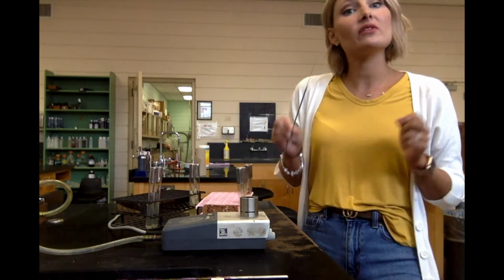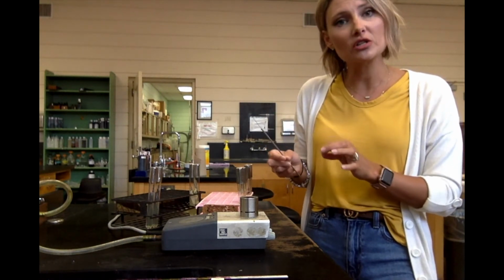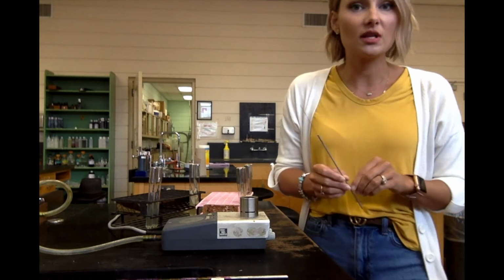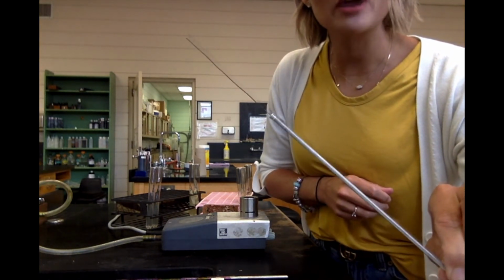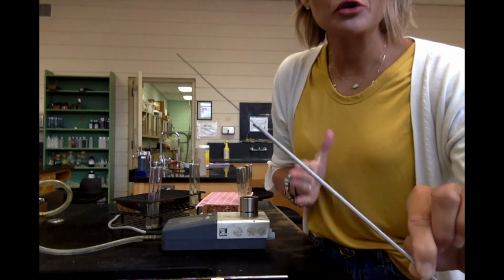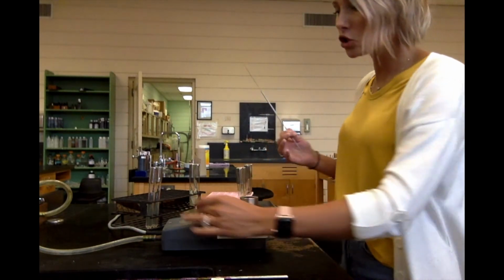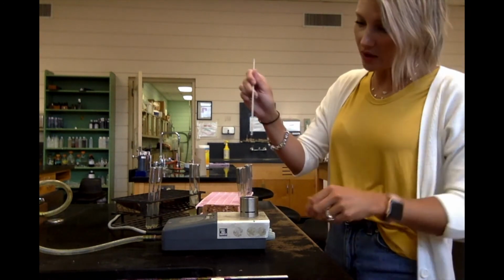So if you remember, we have an inoculating loop. We use that to do all of our stains and make our smears, and we're going to use the inoculating needle to do the stab, because we're stabbing it, so it would make sense we need to use a needle. So this is what our needle looks like. Okay, you want it to be as straight as possible, because when we're reading these results, we want our stab line to be really, really straight. So I've already straightened it, and of course we want to use aseptic technique, so we're going to use our fire boy. We're going to flame our needle, so you want to treat this just like if it were a loop. So we're going to flame our needle.